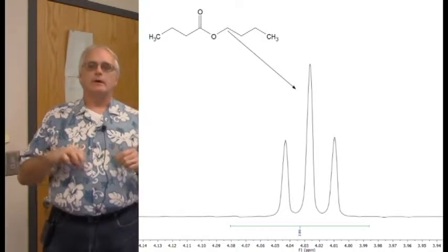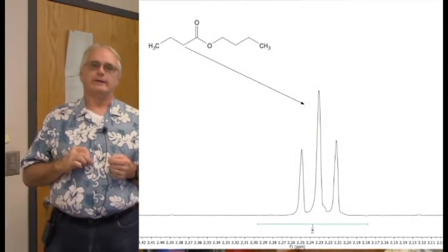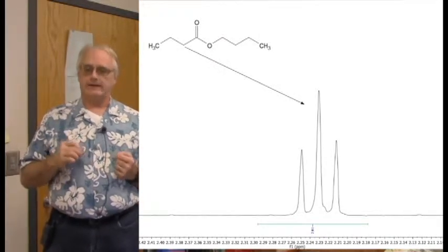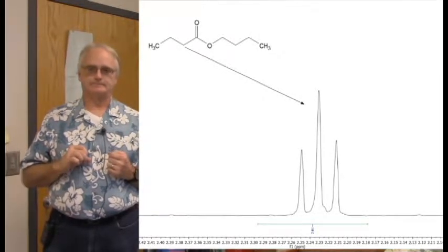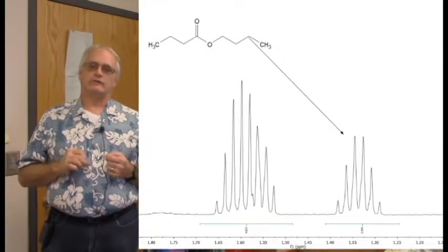Beautiful. We look at this one over here next to the carbonyl carbon. It's just over 2 ppm, like we would expect it to be. It has 2 neighbors. It too is a glorious triplet. Beautiful.